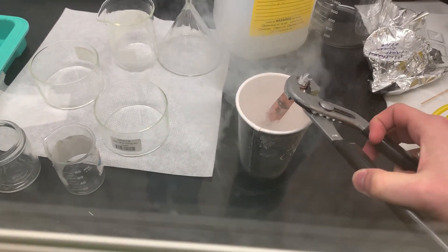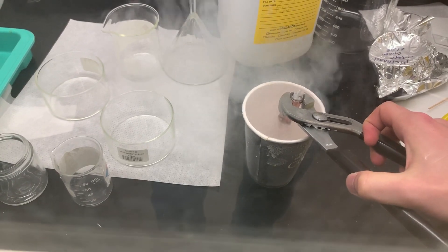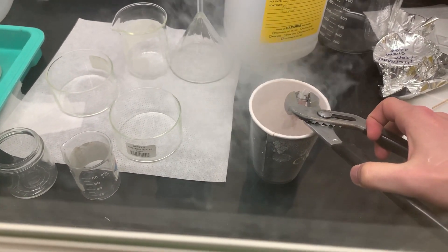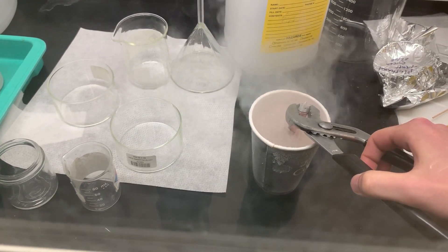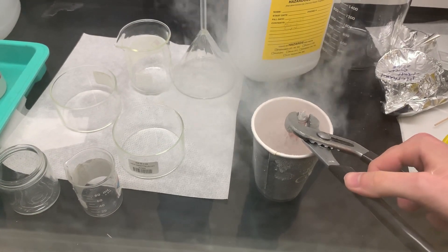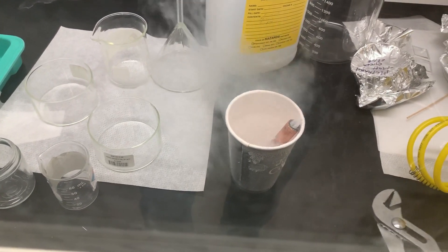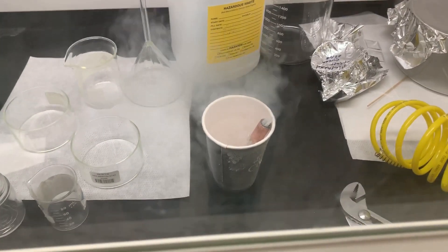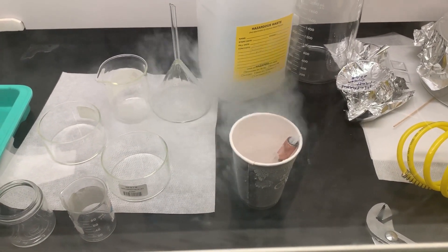So now you can slowly put this in. It's a long vial — it'll be recoverable. Now let's wait a few minutes for it to freeze up and then we can pull it out and see solid chlorine.